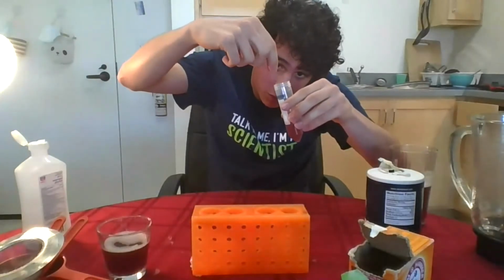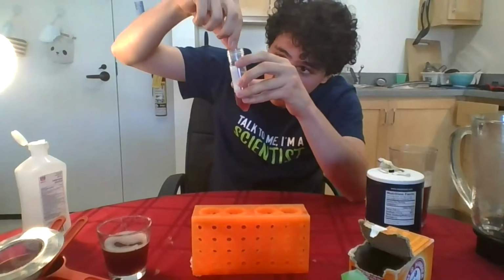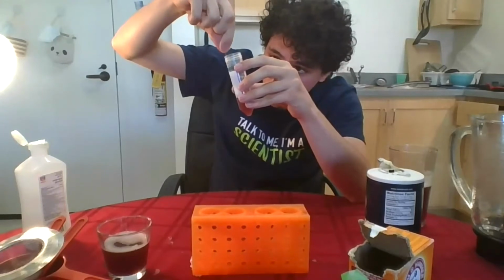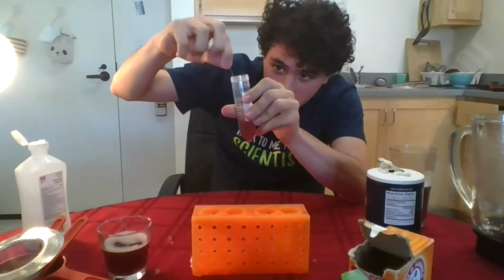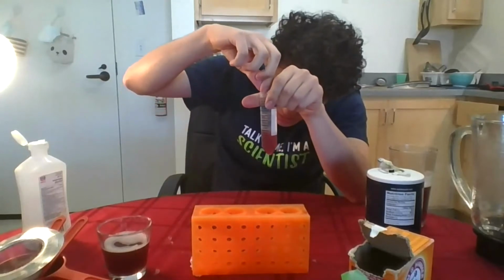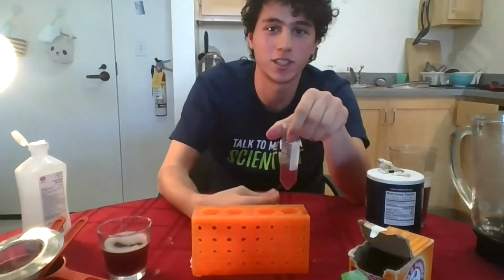The problem with grabbing it is that it's very mushy and very viscous, so it's not easy to actually grab to show you. And I'm having a hard time seeing it myself. Some might not be possible to grab just because of the way it came out of solution. There's a little bit of a white background making it harder for me to see it. And I might not be able to grab it, guys. It doesn't always come out in a way that allows you to grab it.